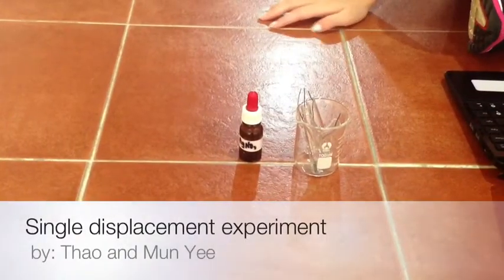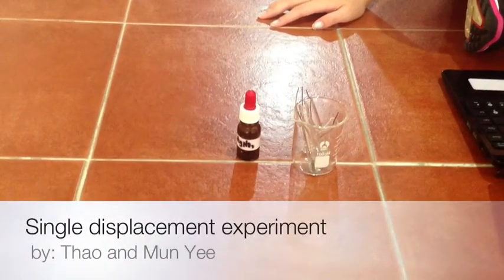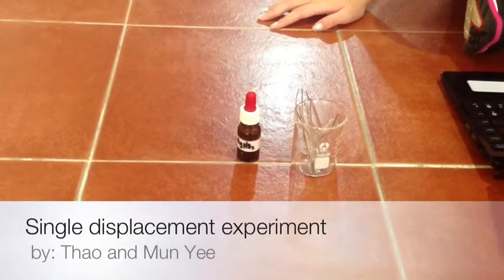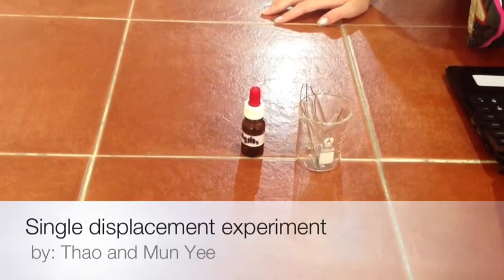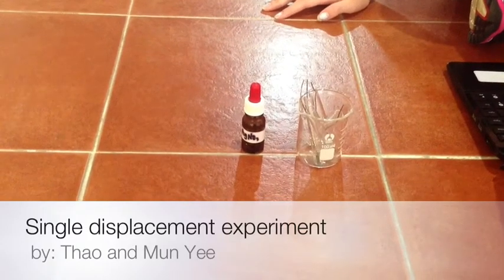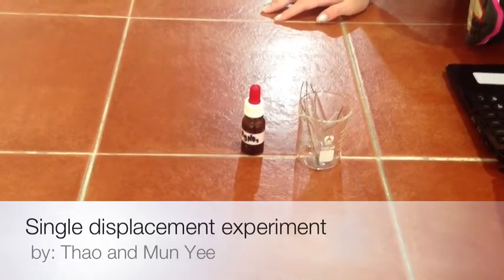Hi guys, today we're going to conduct a simple experiment to show you how to tell when a chemical reaction takes place between a silver nitrate and a piece of thin copper wire.